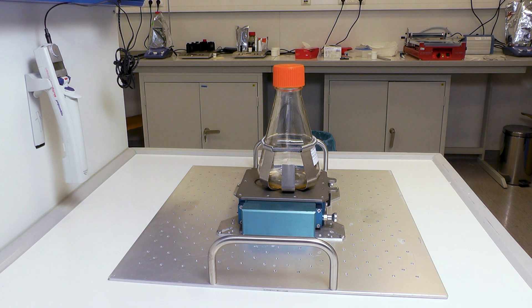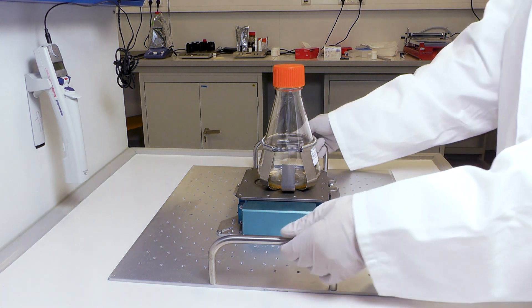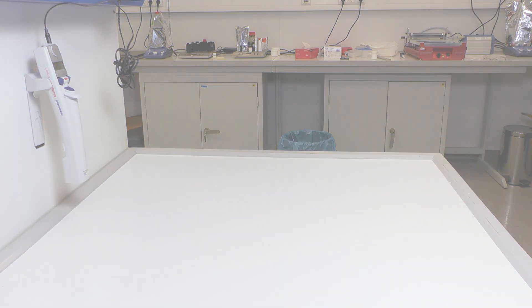This is how you install universal clamps on your SFR or SFR-Vario to prepare for your shakeflask measurements.